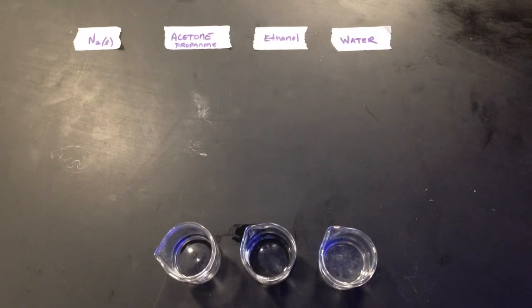So what I'm going to do is take these three liquids and observe who evaporates the fastest, and make some observations regarding how fast they evaporate, and two, the forces of attraction between the compounds. Now what I mean by that is, we're going to use this word intermolecular attractions. These are not bonds. These are attractions between the molecules.